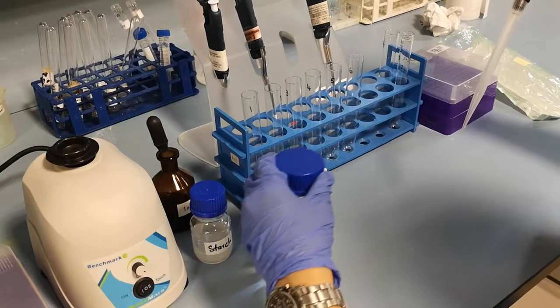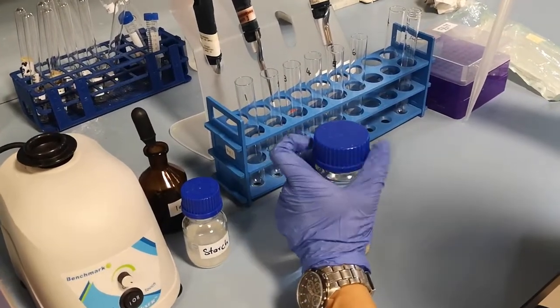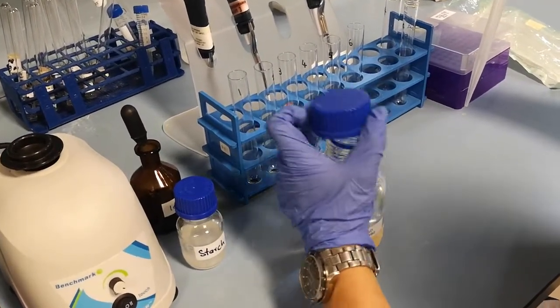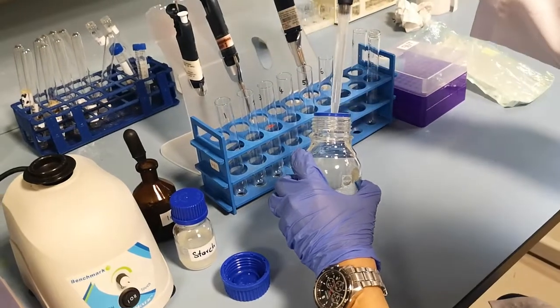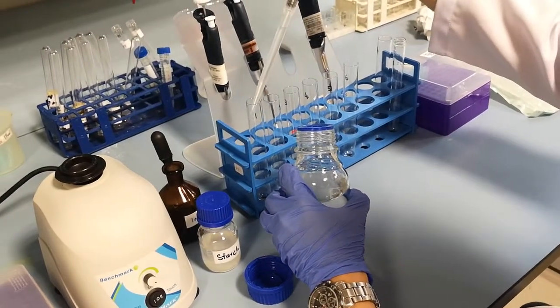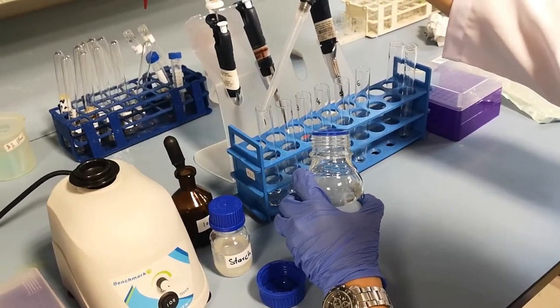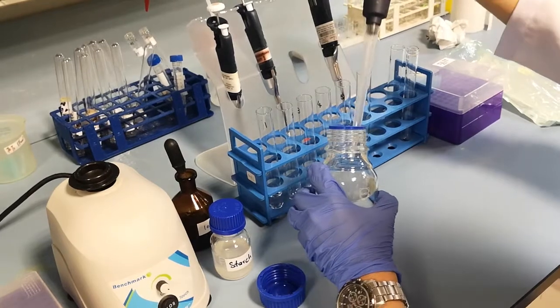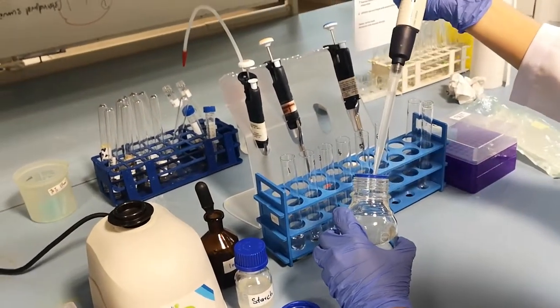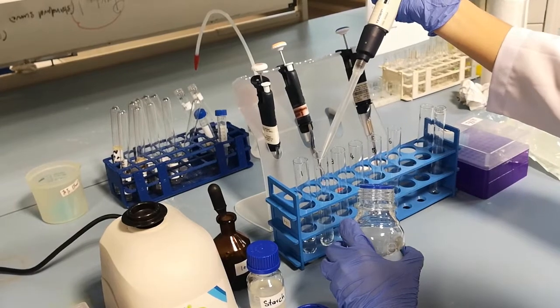Place 9 ml of distilled water in 5 test tubes. The pipetter in this video can only dispense a maximum of 5 ml of liquid. Therefore, we will first dispense 5 ml of liquid followed by 4 ml of liquid.